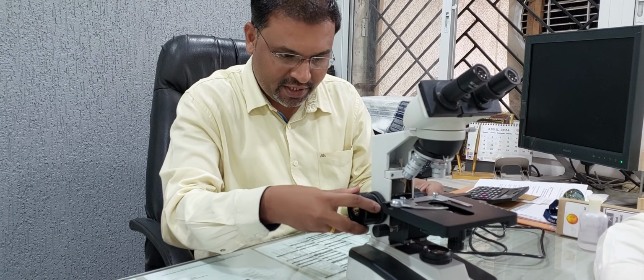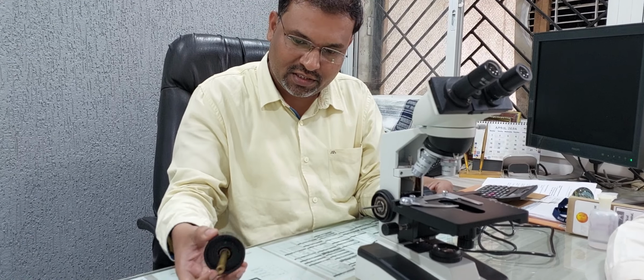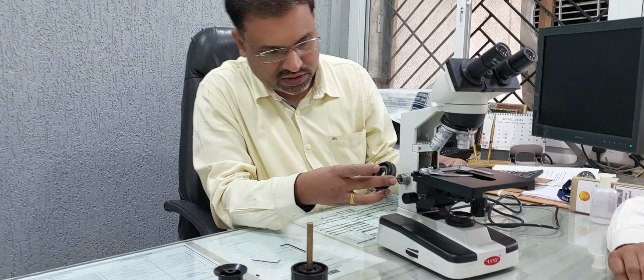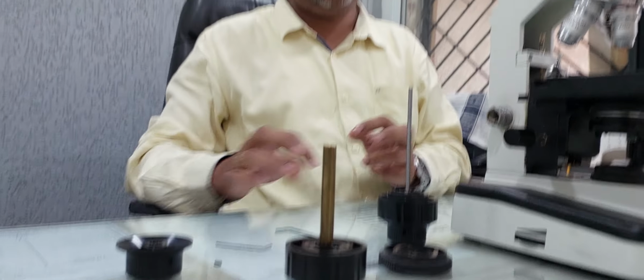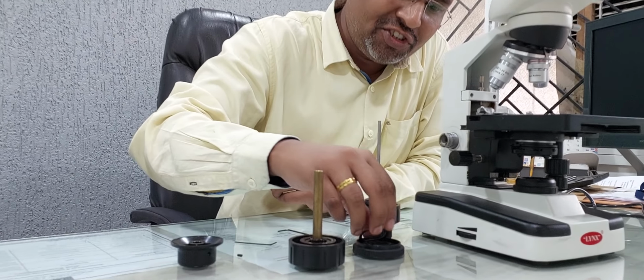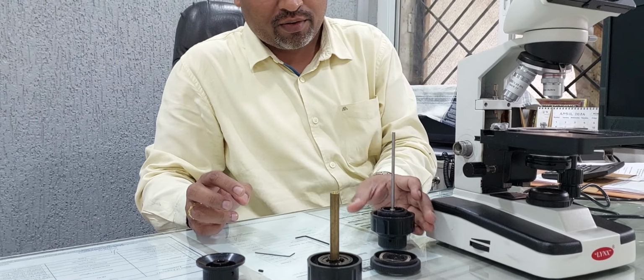See, this is very delicate work. In this way, the gear assembly comes out. You have to concentrate on this washer, and it will come out like this. Come close. So basically, this is the assembly we have dismantled in the microscope. Can you observe this washer is damaged? We have to replace this washer, then only it will work fine.